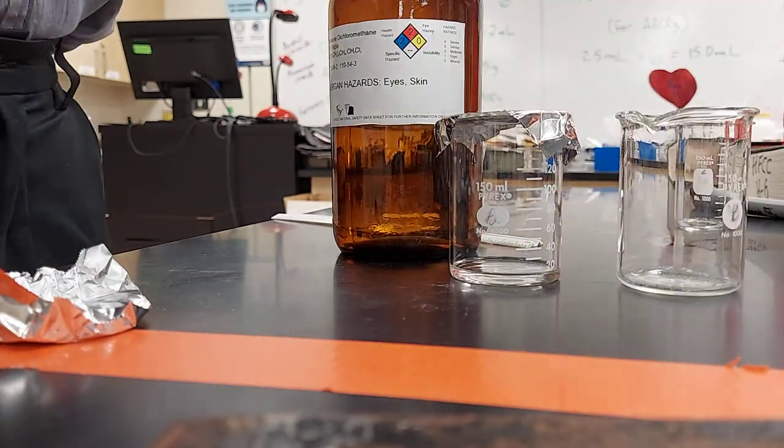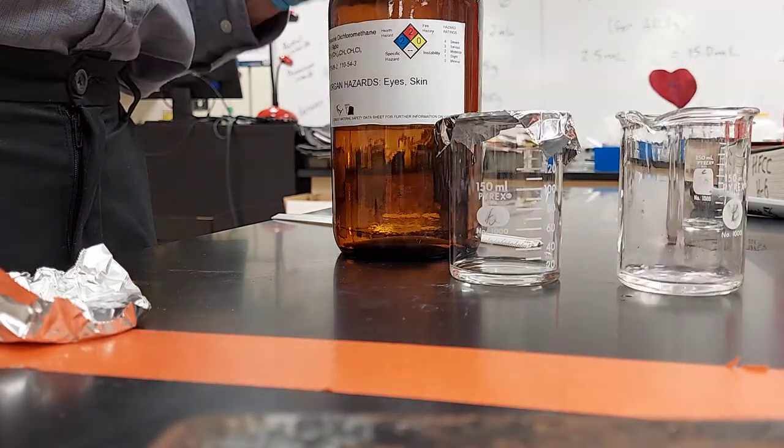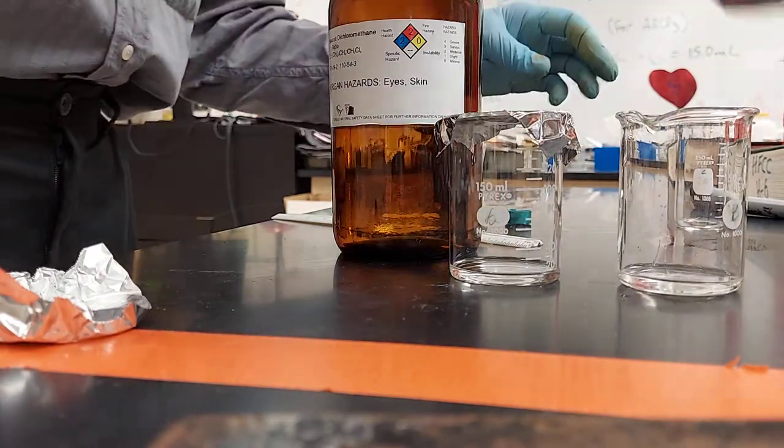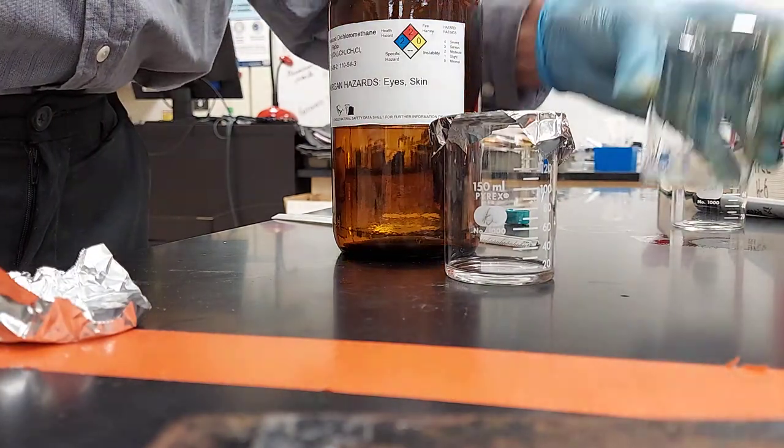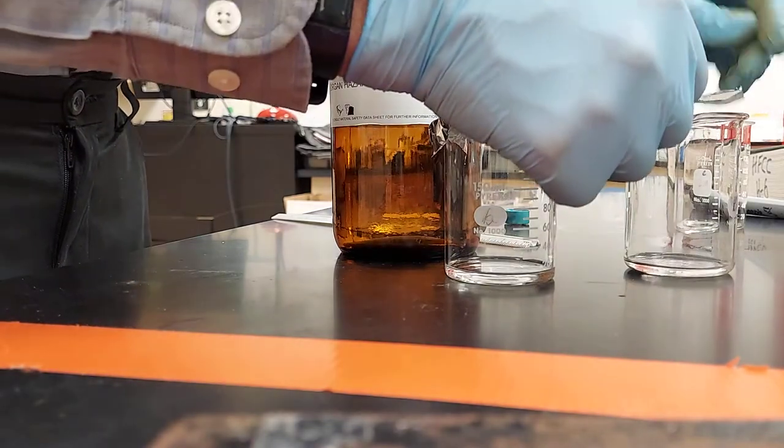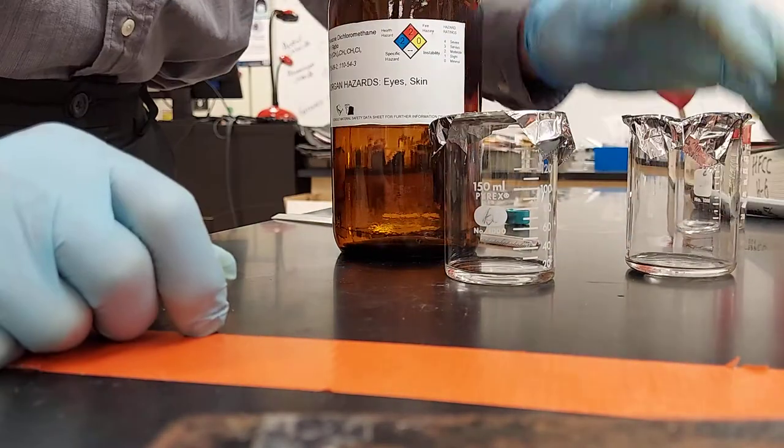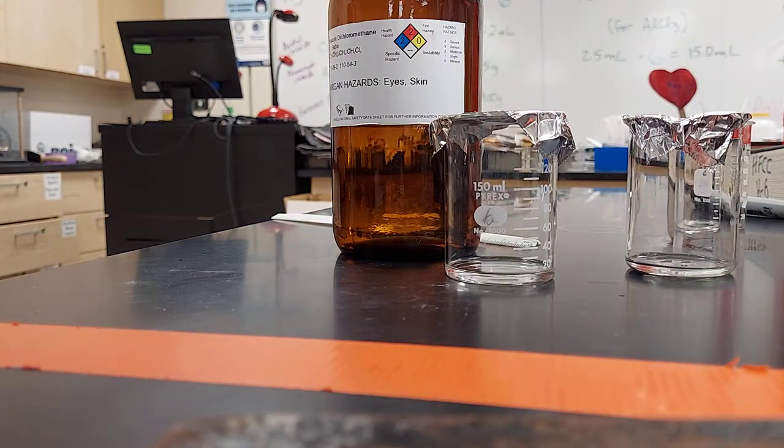And then there's a different one, one-to-three hexane to dichloromethane, same idea. That may have been a little too much - pour it back. The lid stays on for five full minutes. So we'll be coming back in a second.